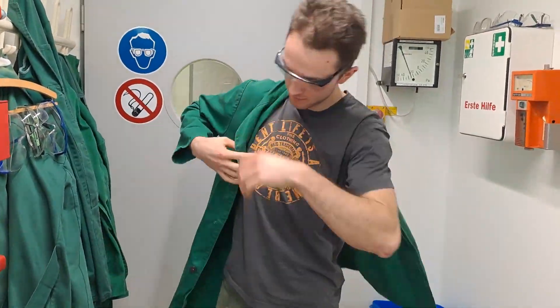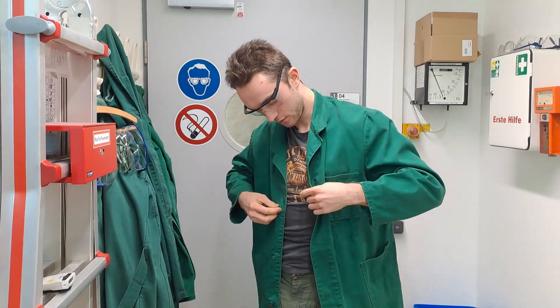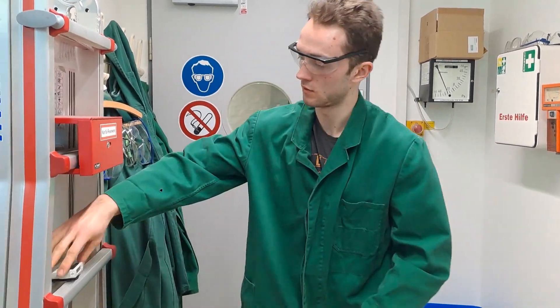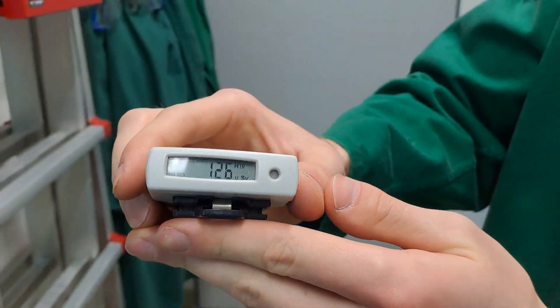The video is intended as an experimental tutorial for students at the University of Cologne, and the experiment should only be carried out in a professional setting within a specialized nuclear laboratory.